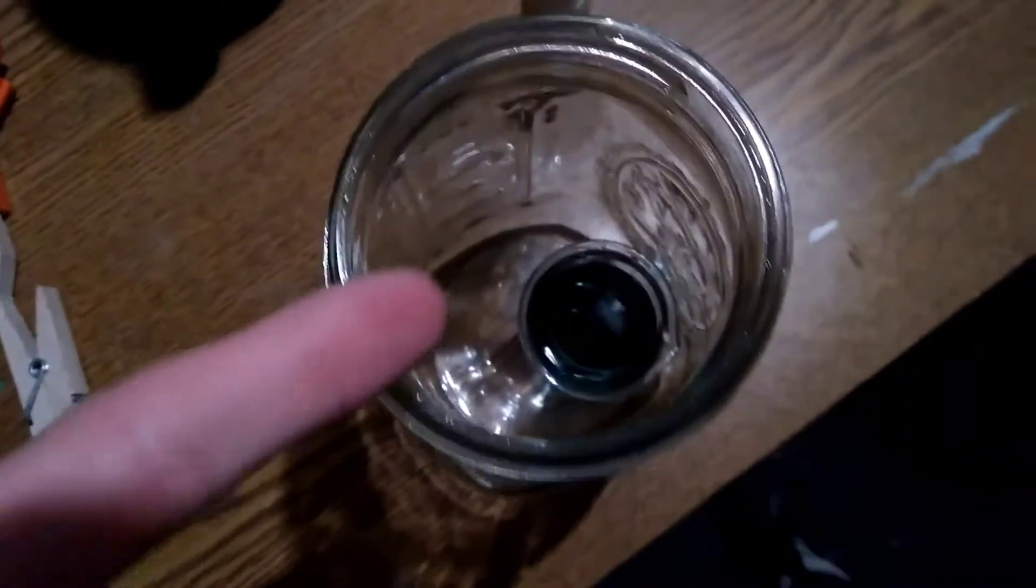So now that it's mixed in, well, kind of. As you can see, it's only on the top. But let's move it into the vacuum chamber. Of course, this won't look as good, but it looks the same color to me in the jar itself.